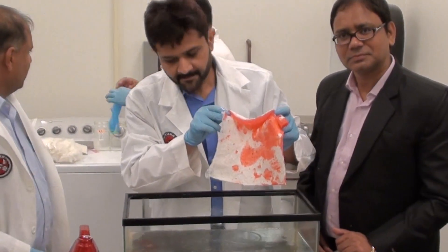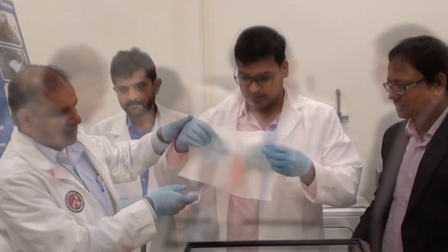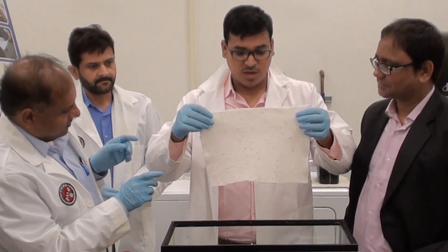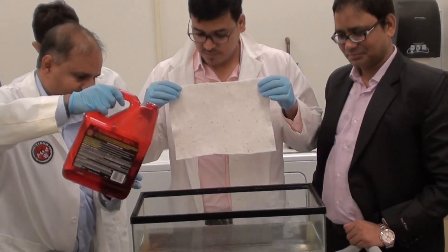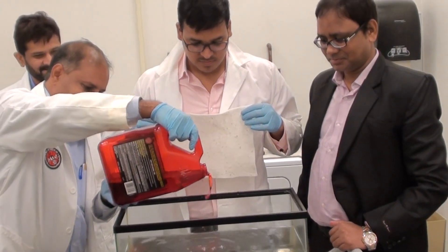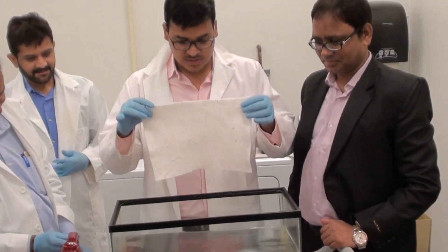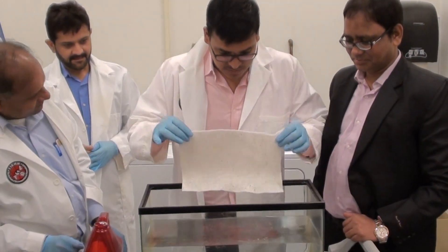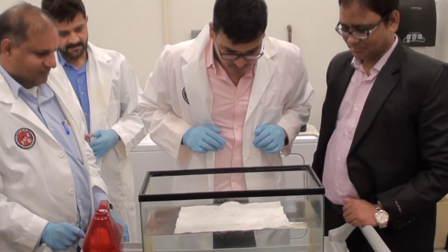Who wants to come? Remove your water sample. Now see — it will not absorb the water. Here, water is there and we have put some oil. New technology: water will not be absorbed, but it can take all the oil from this.